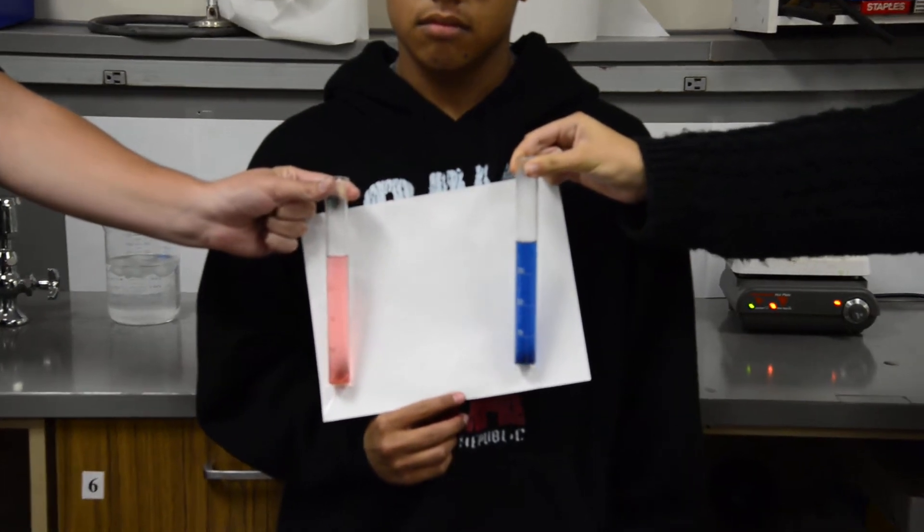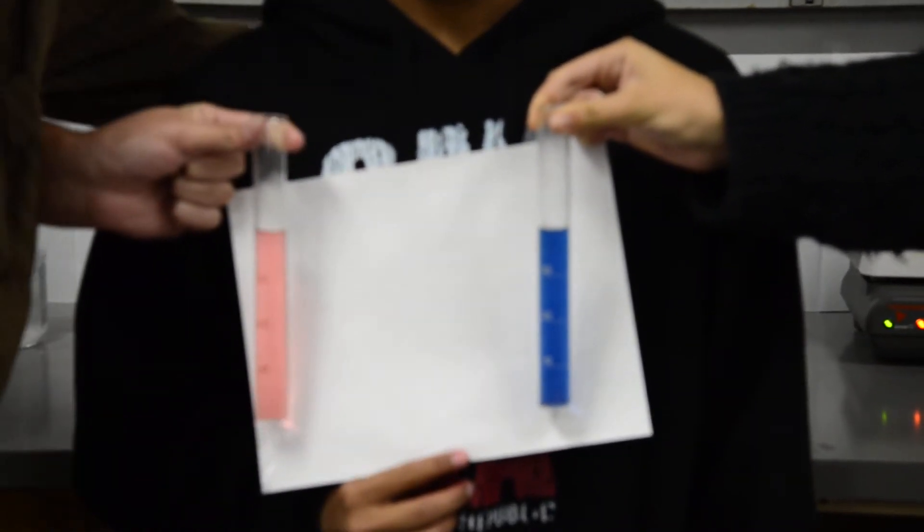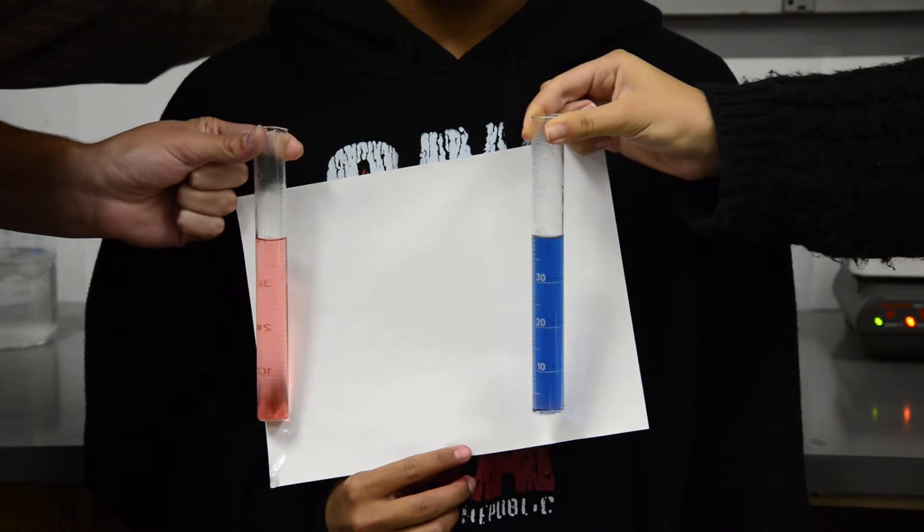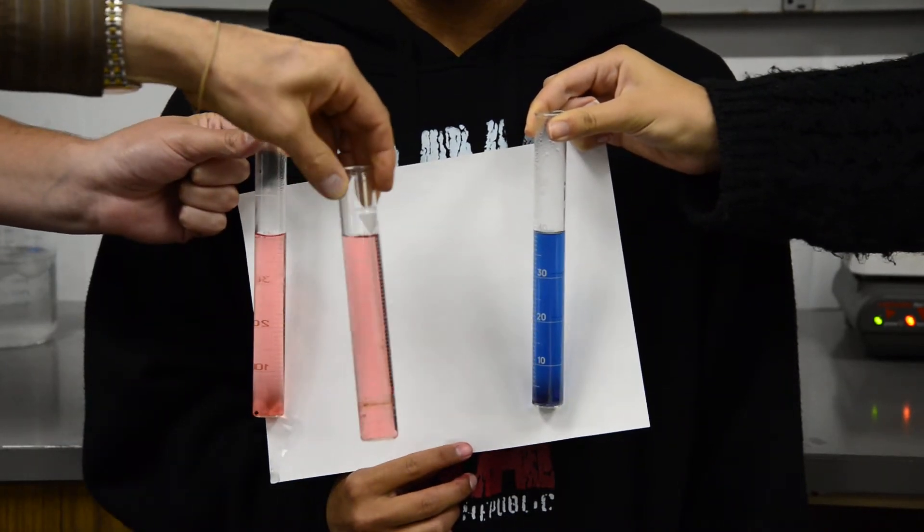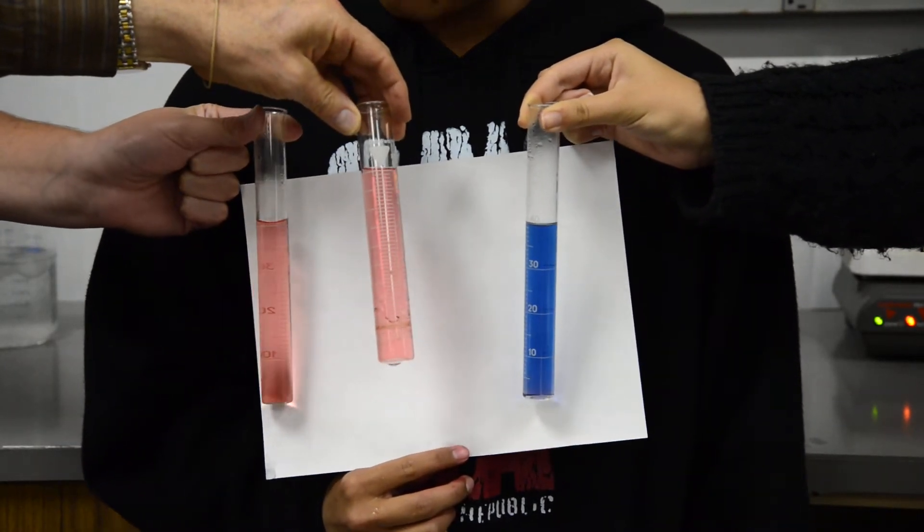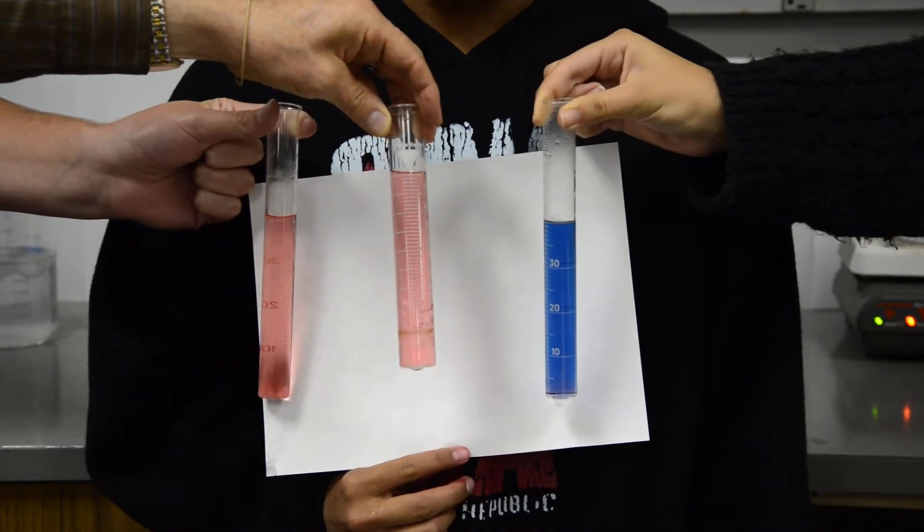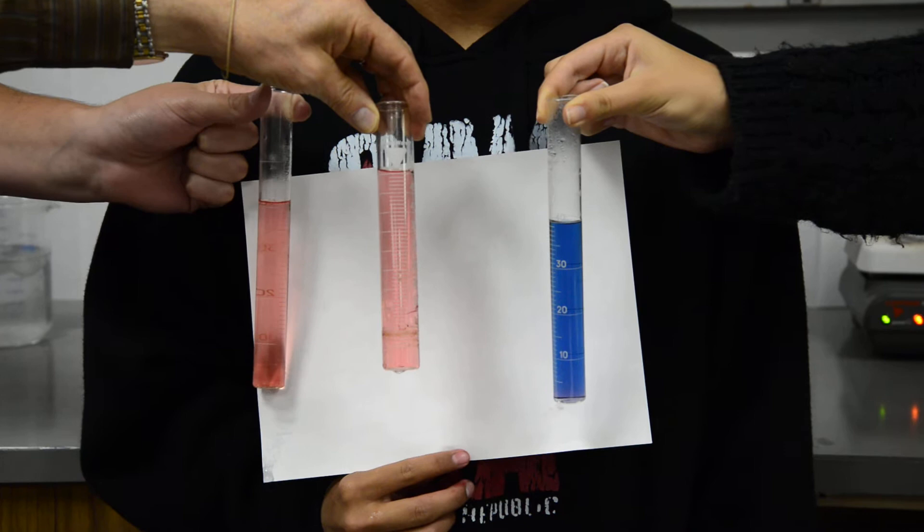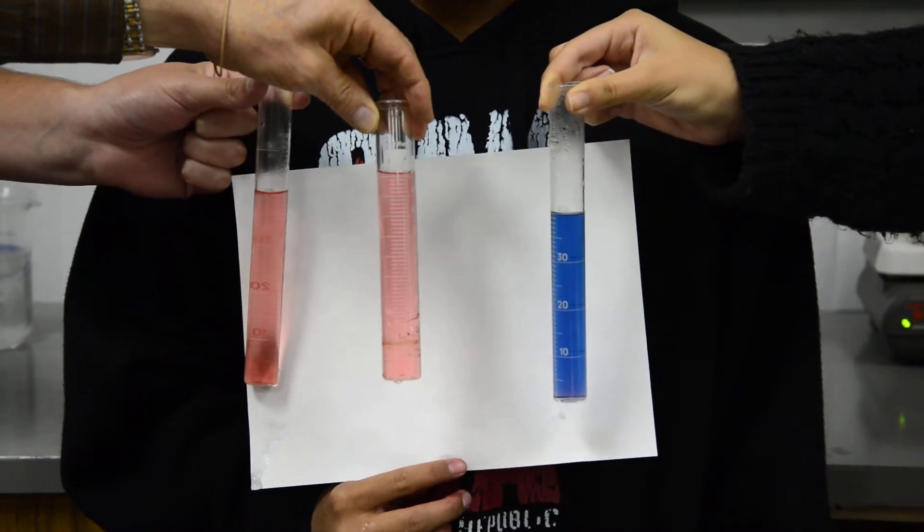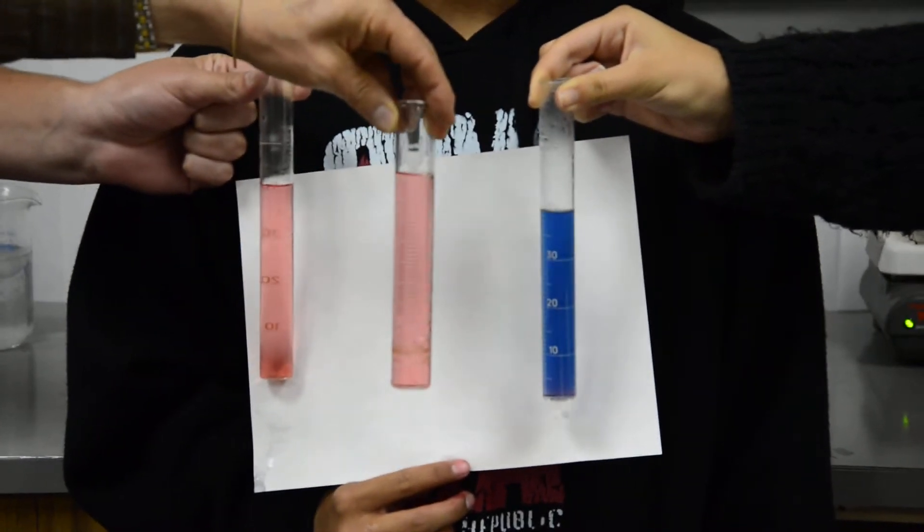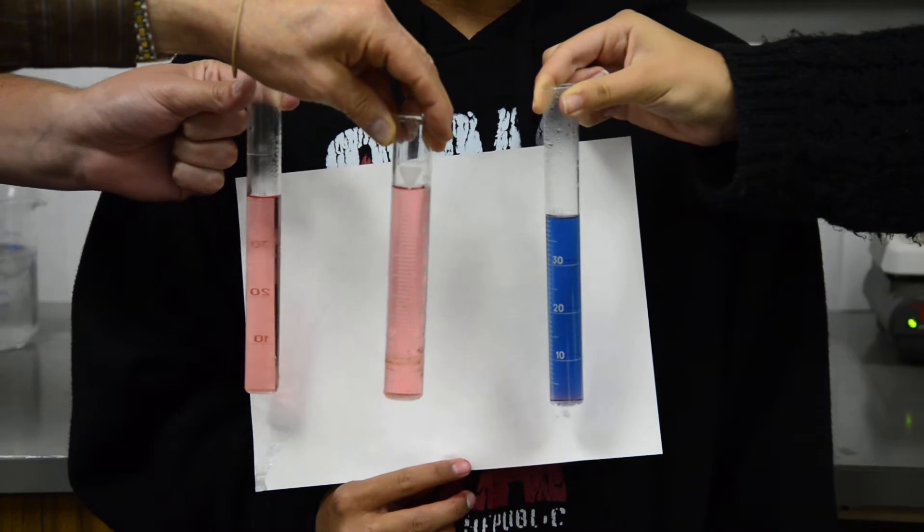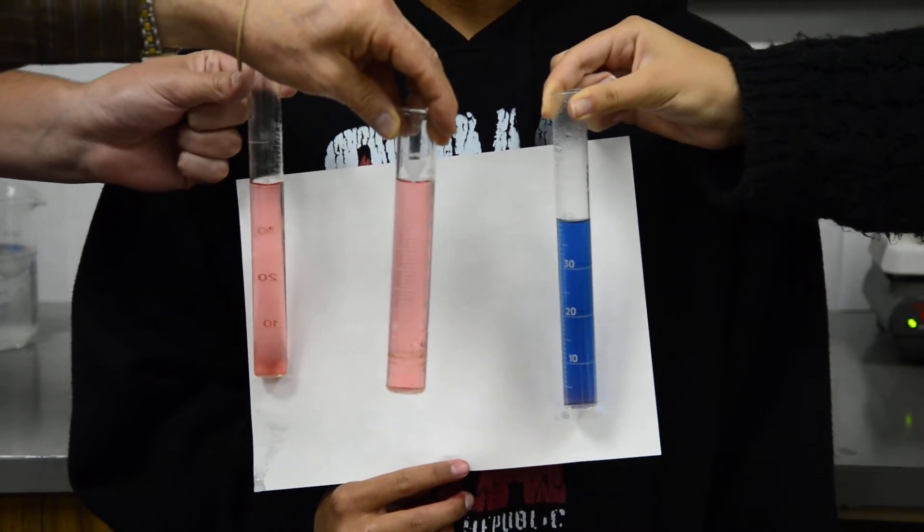If I get the tube that's in the middle, you can see that it's a little thicker, so it looks a bit darker than the tube on the left. But this is our control and we'll use this as comparison when we change from hot water to cold water.